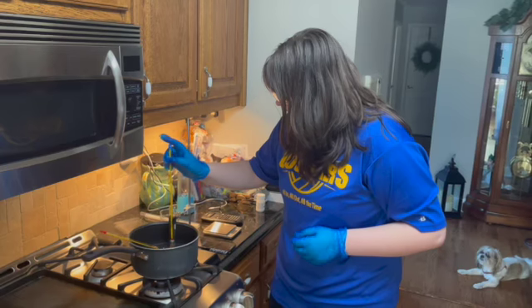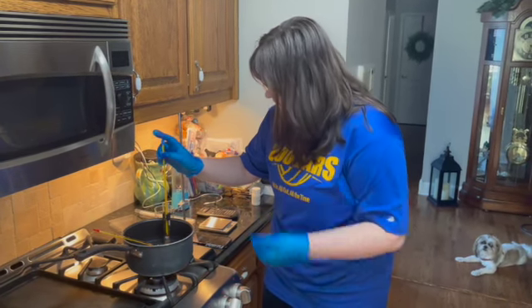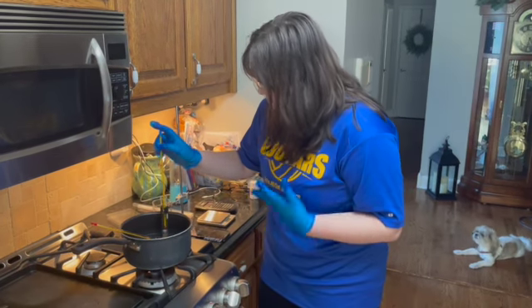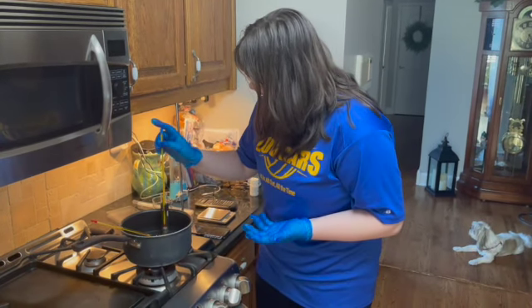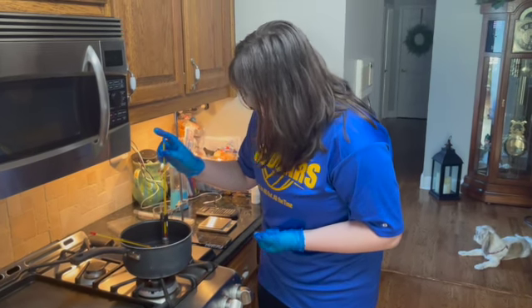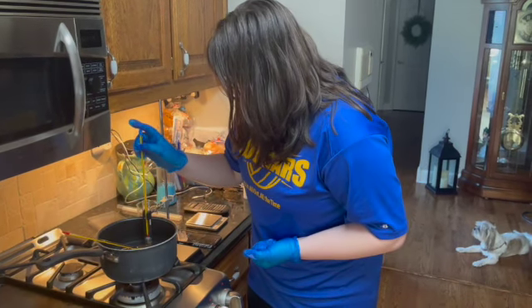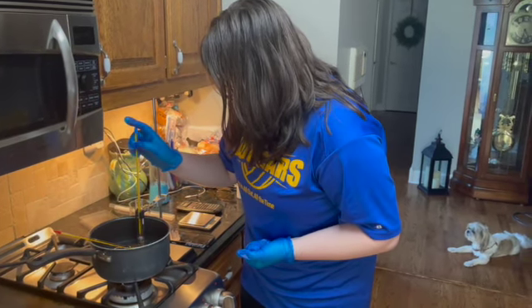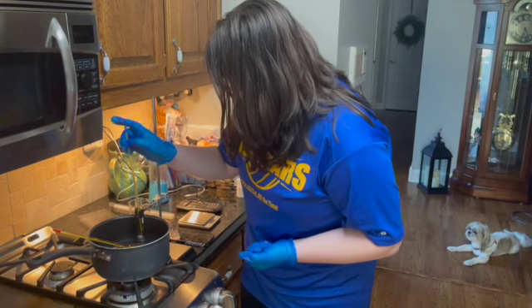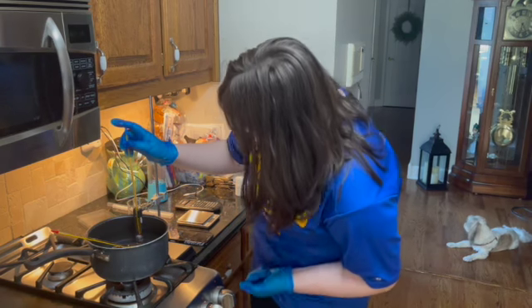So what's happening here is that we are trying to melt this paradichlorobenzene into a liquid form. And right now, it doesn't seem like I see any real difference. Of course, it goes along with time, but we have just started. So let's see.